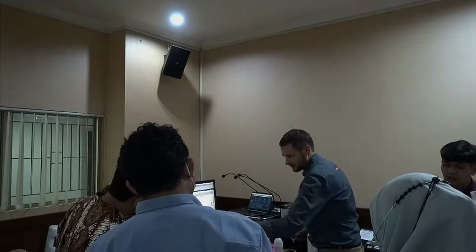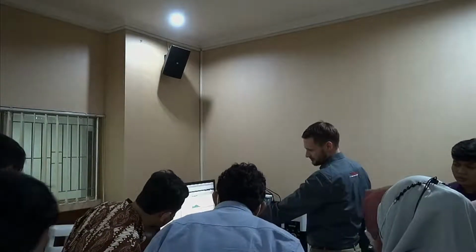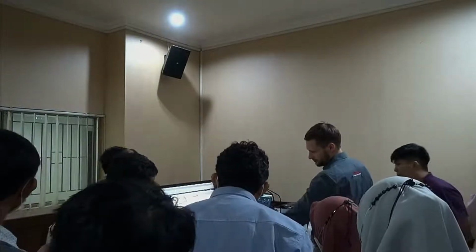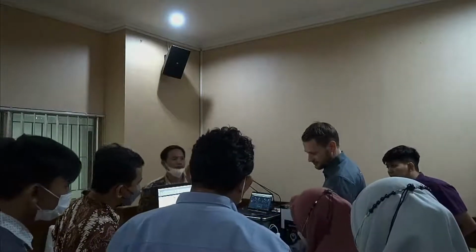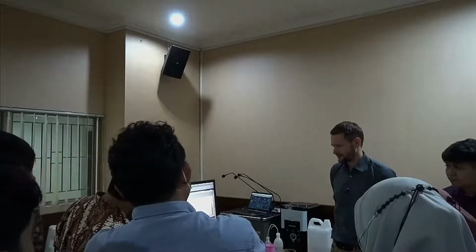So there you see the countdown I mentioned. You can, of course, end the dispersion process manually as well. Or if you add too much, you can click dilute. Of course, only if you have a tap water connection, then it will dispense some of the dispersion and get fresh water in order to lower the concentration and get your desired beam obscuration back. In this case, it looks actually nice. Here you also see the aforementioned temperature monitoring, which is very stable, which is nice to have.